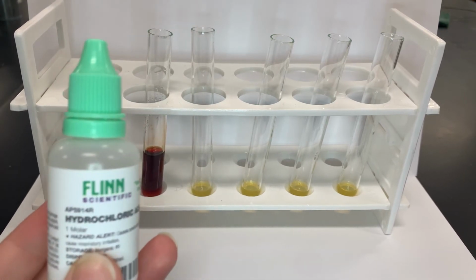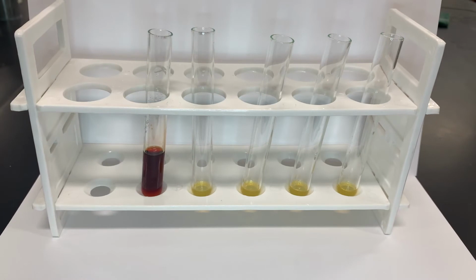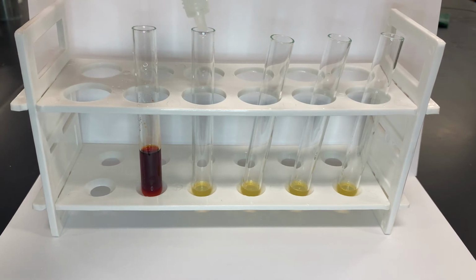Now let's observe what happens when those vegetables enter the stomach and interact with your stomach acid. Stomach acid consists primarily of hydrochloric acid. Will the acid be enough to convert non-heme iron, or Fe3+, into heme iron?